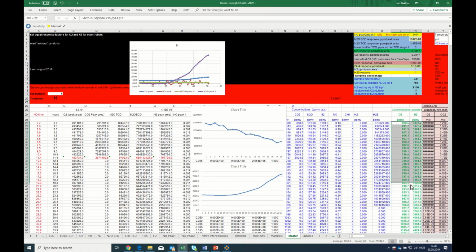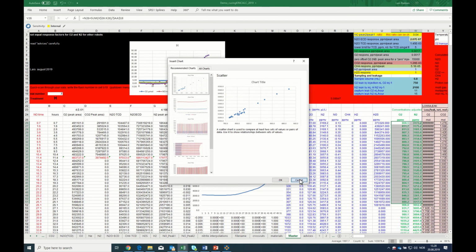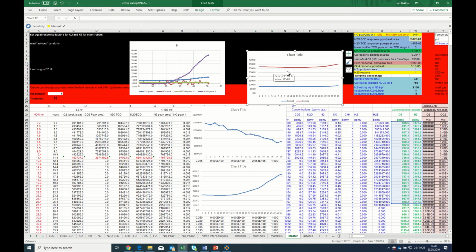these curves actually look quite nice. So what I've done is that I've essentially stabilized the first part by the leakage of oxygen and nitrogen, and then assume that I have the same leakage throughout for my experimental vials. The advice here is to never use completely dry standard vials, but inject anything between 0.1 and 1 milliliter of water into your standard vials and you avoid this problem.